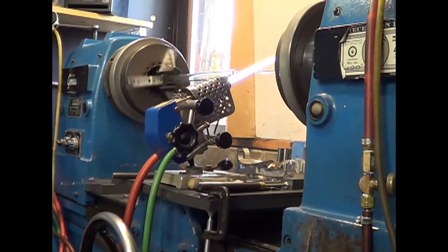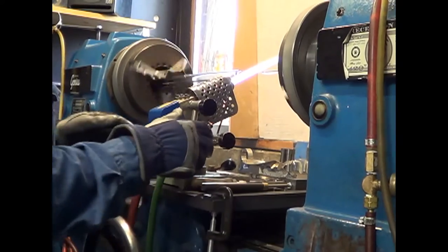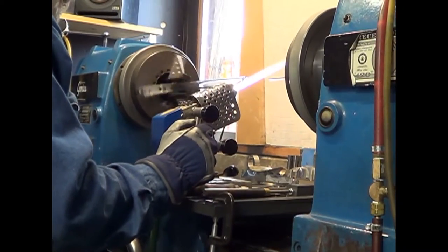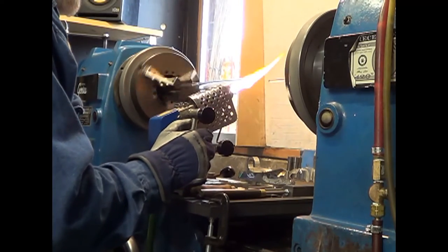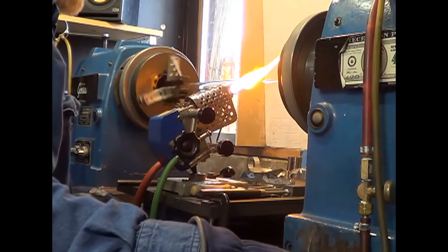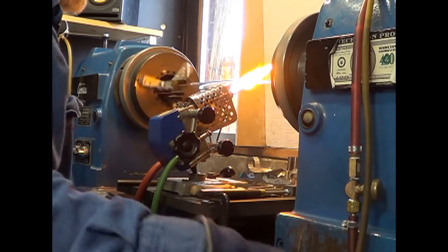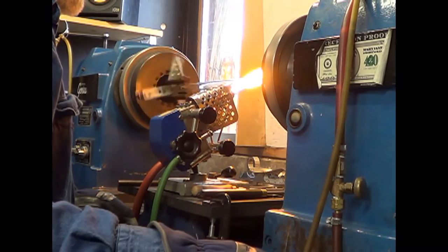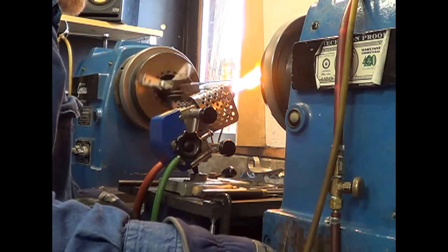Here with the Easy Jeezy. Today we're working on the glass lathe. What we have here is a 65-year-old commercial lathe, and we've got a tube chucked up in that left-hand side, and a solid rod in the right-hand side, and what we're going to do is join the two together.